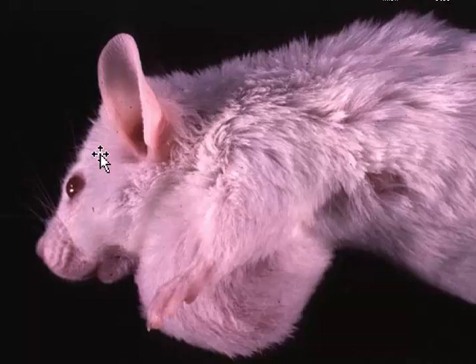Okay, when I look at a mouse and I see a large mass in the skin just about anywhere, I'm probably going to think about mouse mammary tumors first, because mammary tumor viruses are also extremely common in mice. However, in certain types of inbred mice, white inbred mice, especially Balb C, and the females are more predisposed, there is a particular type of neoplasm which arises from the myoepithelium of the salivary gland. We call these salivary gland myoepitheliomas.